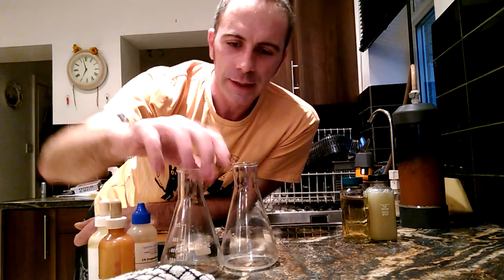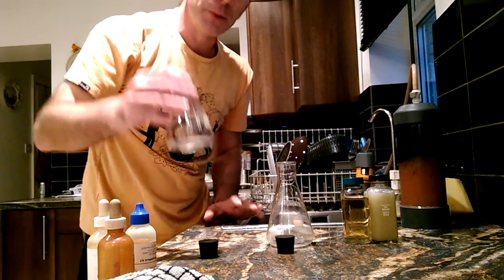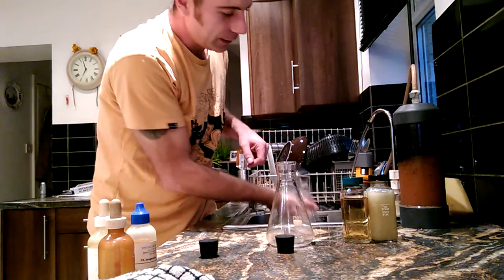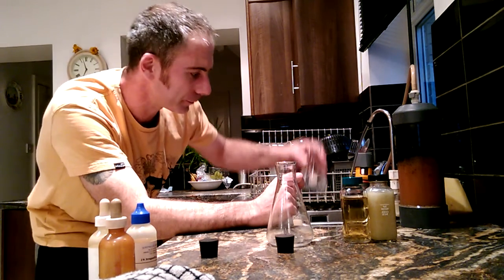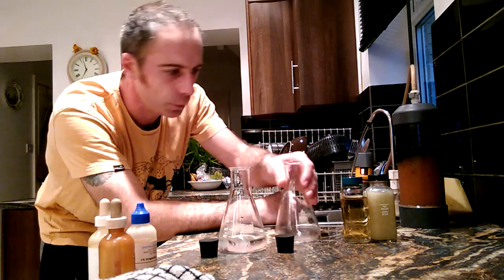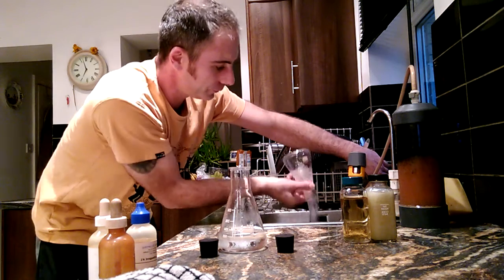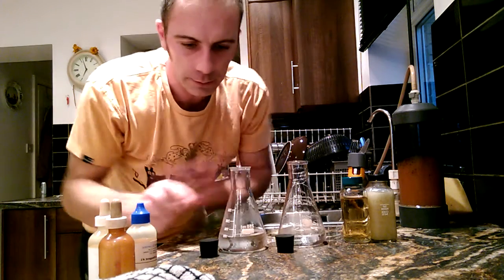I'll get into a little bit more detail with that as we go on, but first I'd like to show you just how much your water is costing you — not just on your health but in your wallet as well. Now we need to take another two samples — purified and tap water. Let's take purified water again — wash out — okay.